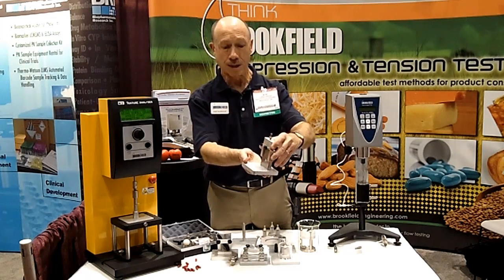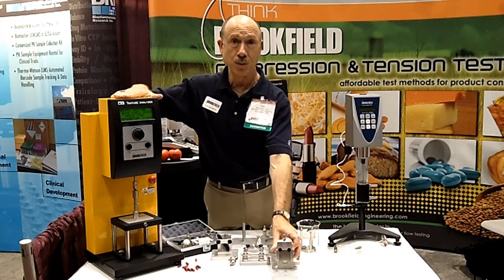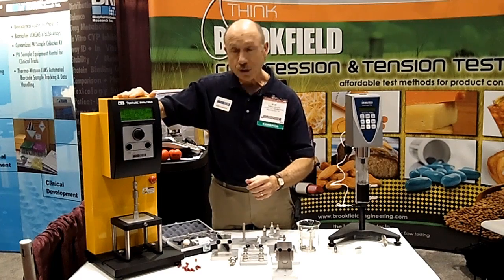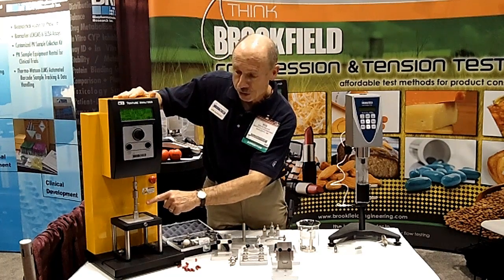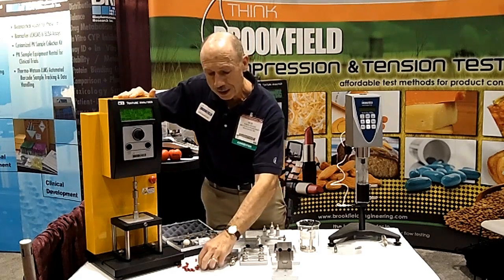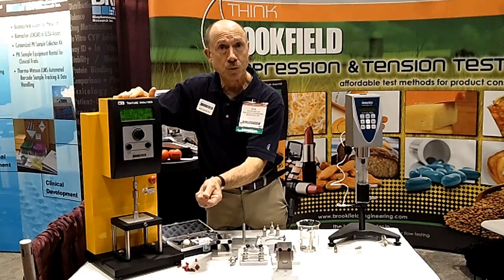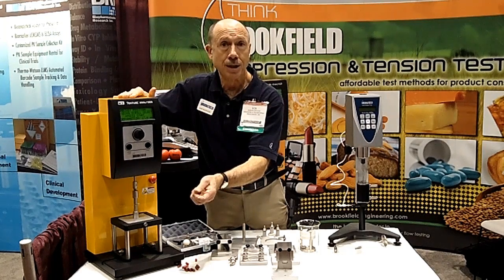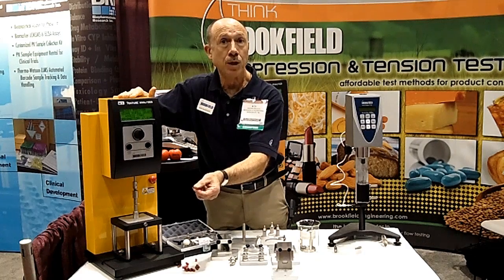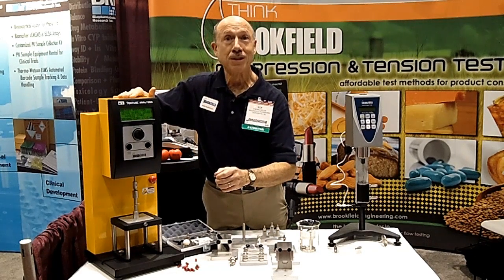When I cut it like that, this machine physically measures the amount of force it takes to do that. If you're interested, I'd like to give you a demonstration on another mechanism called our capsule loop tensile fixture. That measures the actual rupture strength of the capsule wall — how much pressure or stress it can withstand before it physically breaks apart. I'm going to call Dave Larson in to give a little show and tell.